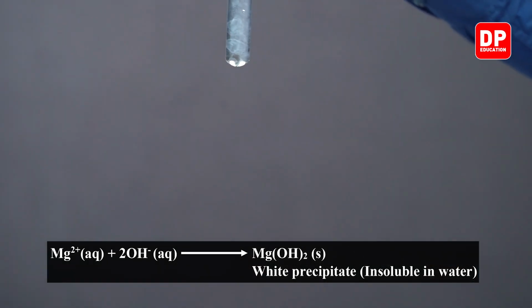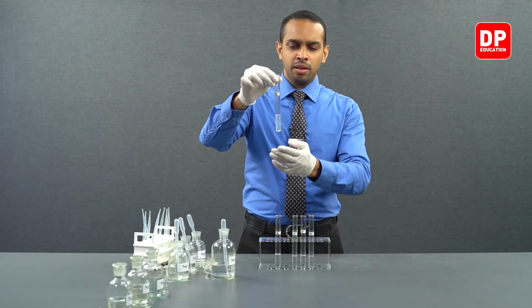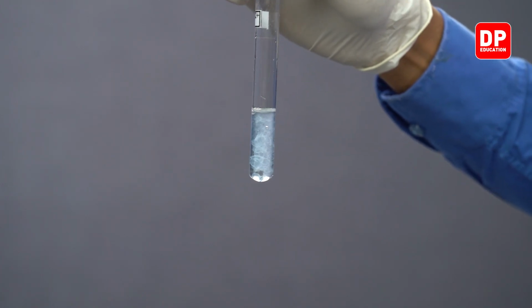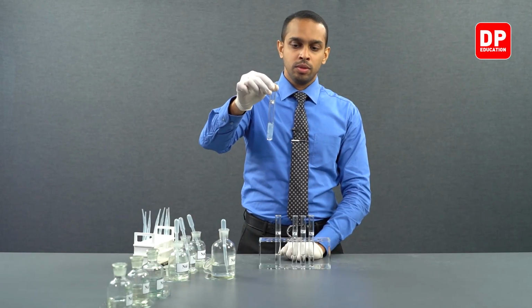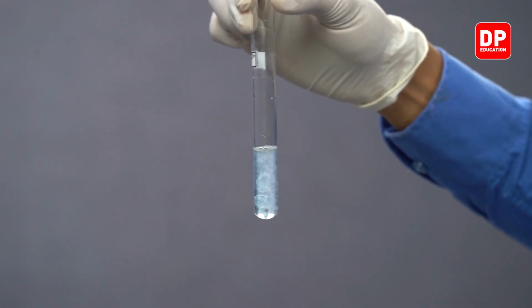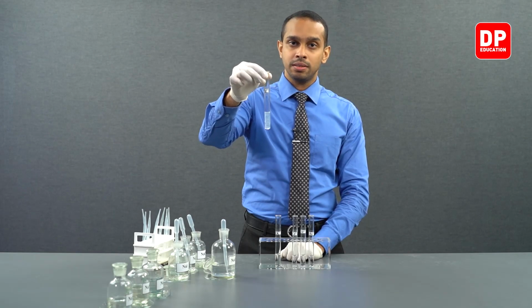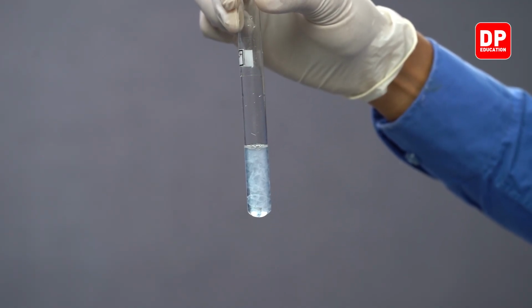We form a white color precipitate. We have here magnesium 2 plus ions reacting with hydroxide ions forming magnesium hydroxide. So, group 2 cation magnesium 2 plus when reacted with hydroxide ions forms a white color precipitate. This is magnesium hydroxide, insoluble in water.